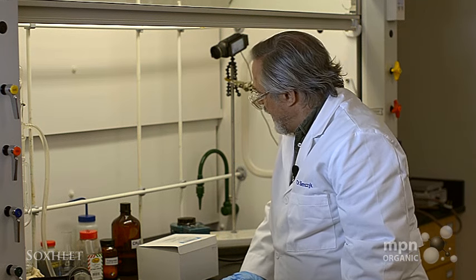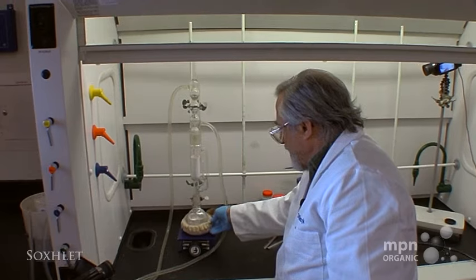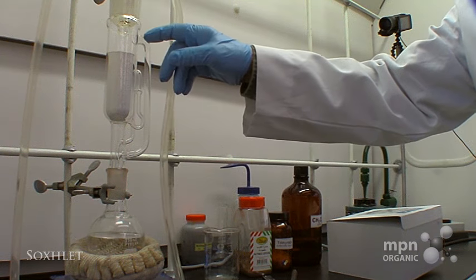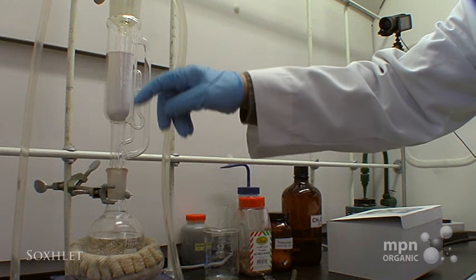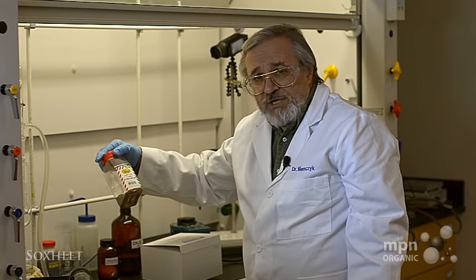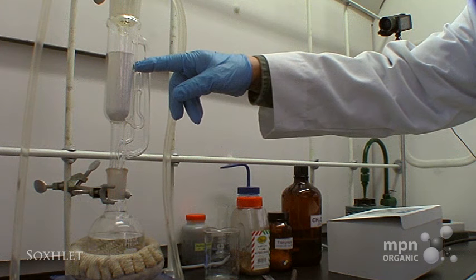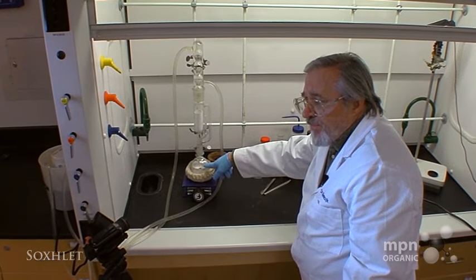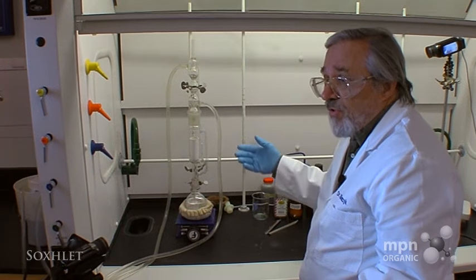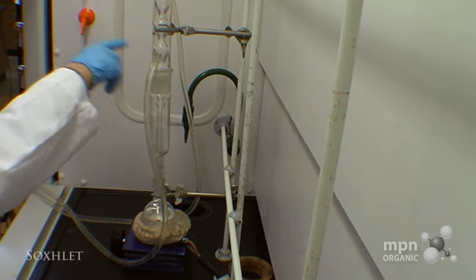Let me explain what you're going to see. The methylene chloride will be heated by the heating mantle, and the vapors are going to come up through this tube and be condensed in this condenser — this is called an Allihn condenser. Then they're going to drip directly down into the thimble full of ground nutmeg. The solvent will filter through the cellulose, fill up to a certain level in the well, and then flow back down into the 250 mL round bottom. I've run these things overnight — they're very, very efficient, as long as you make sure the solvent is being effectively condensed.